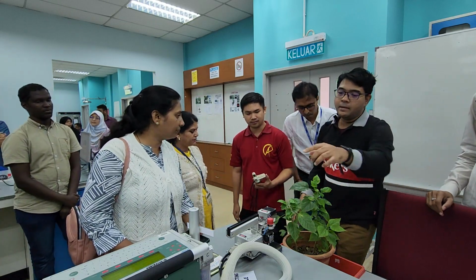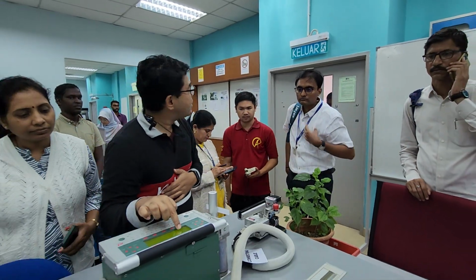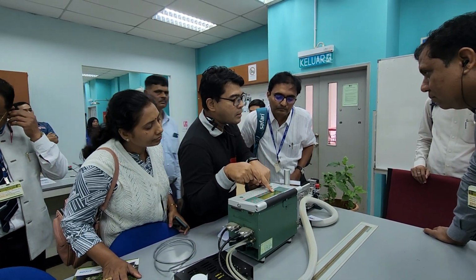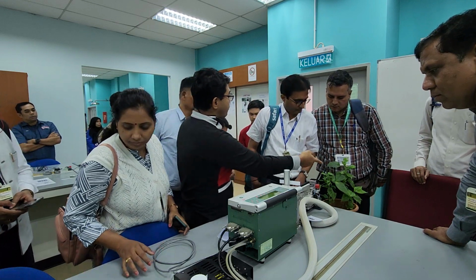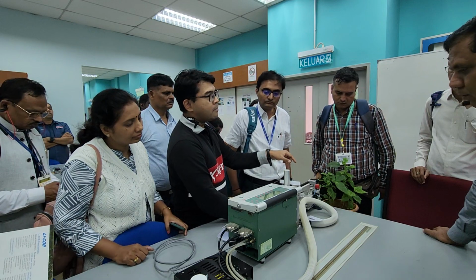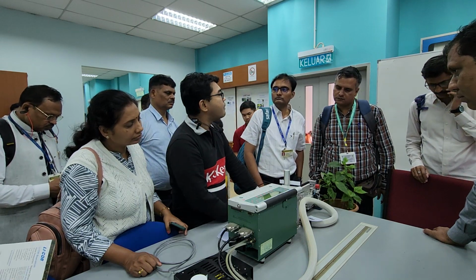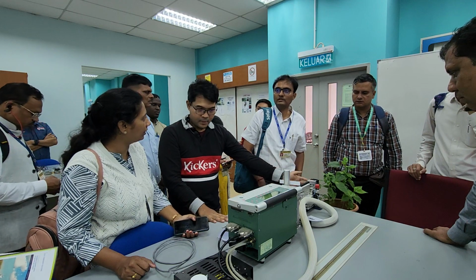For example, here the reading is actually negative. Oh, it's low positive 1. Just now it was negative, because it was experiencing photorespiration. This is a C3 plant, meaning it experiences midday depression from around 12 until 3. This is inside the cabin. That's why it's showing like that.